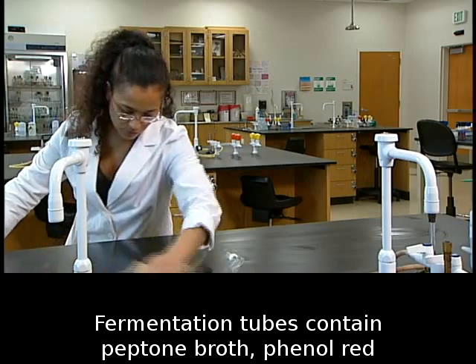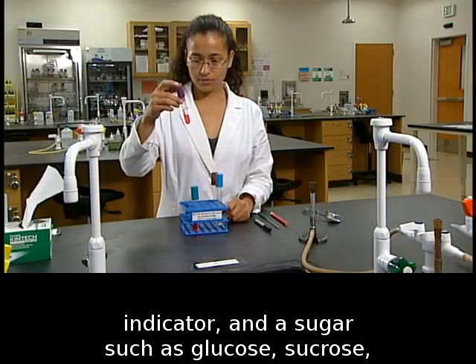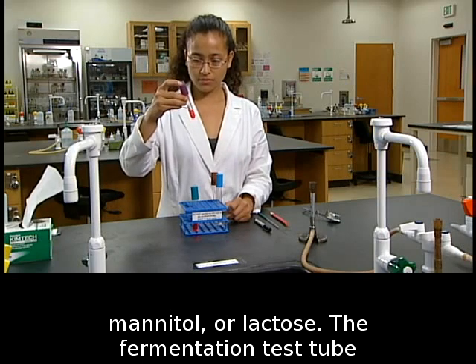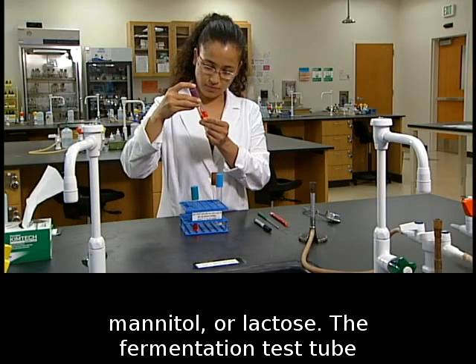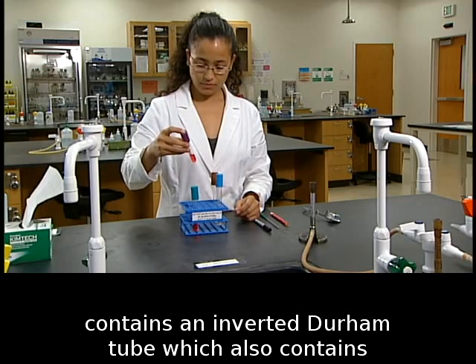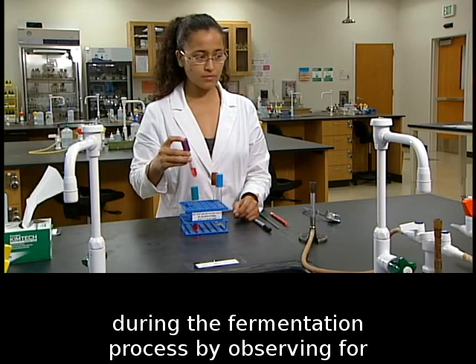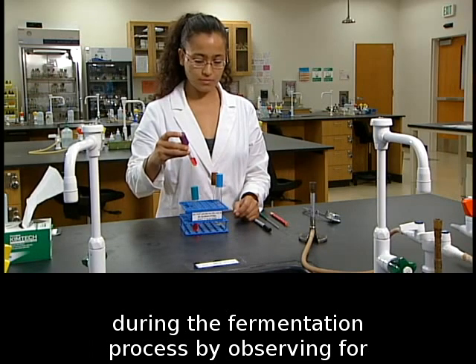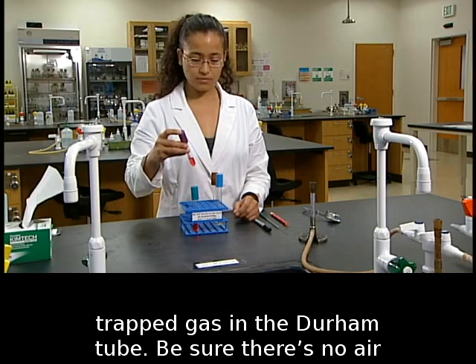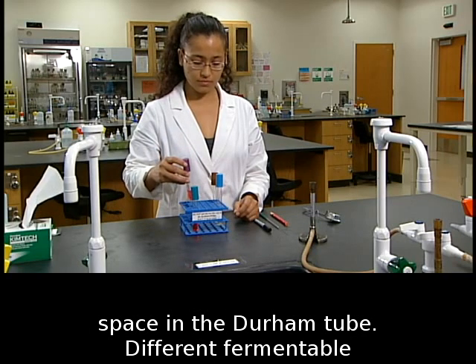Fermentation tubes contain peptone broth, phenol red indicator, and a sugar, such as glucose, sucrose, mannitol, or lactose. The fermentation test tube contains an inverted Durham tube, which also contains broth and is used as an indicator of gas production during the fermentation process by observing for trapped gas in the Durham tube. Be sure there's no airspace in the Durham tube.